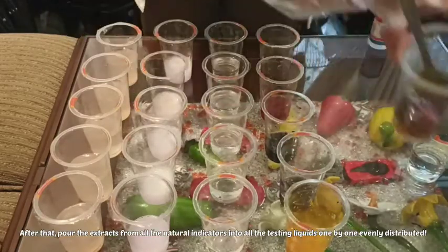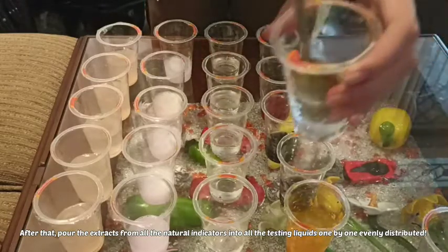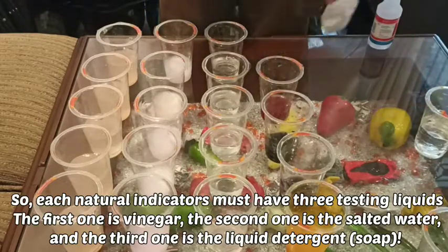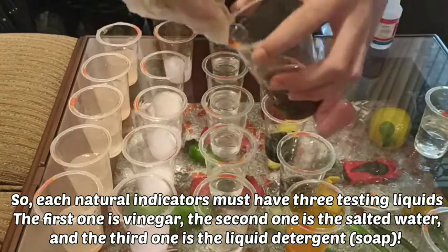After that, pour the extract from all the natural indicators into all the testing liquids, one by one, evenly distributed. So, each natural indicator must have three testing liquids.